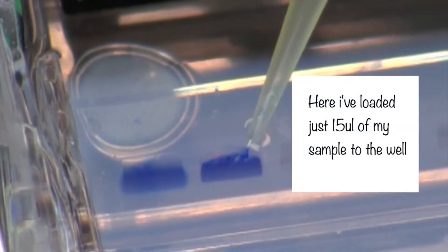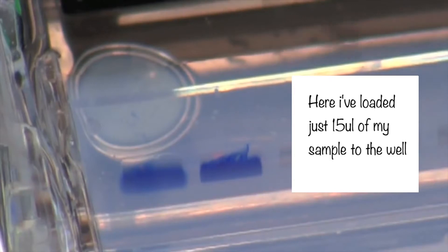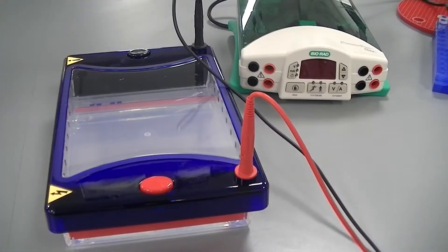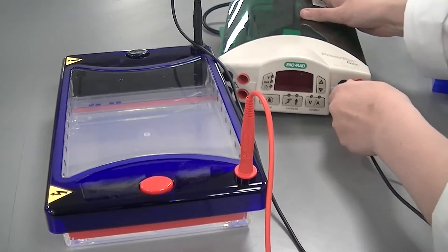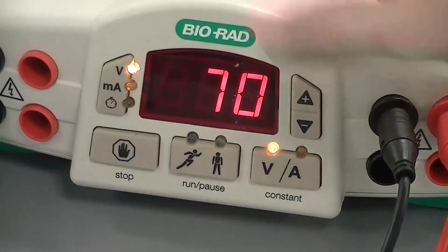Place the lid on the tank and connect to the power pack. The voltage depends on the type, percentage and size of gel used. The higher the voltage, the shorter the run time.